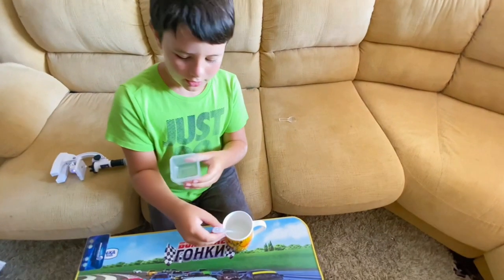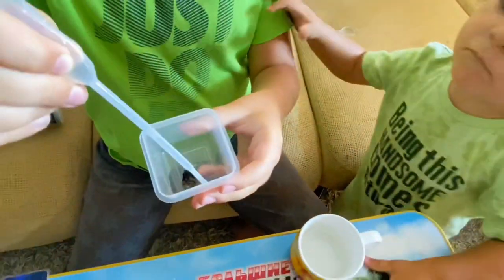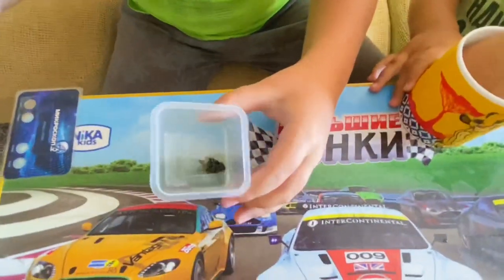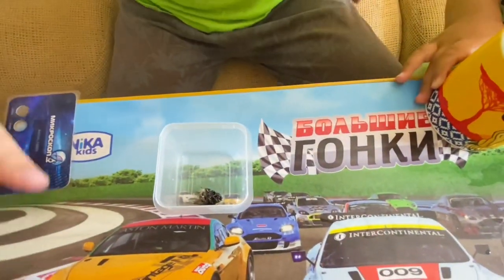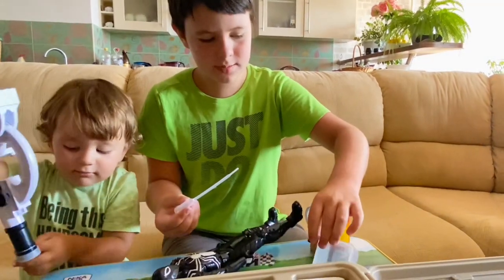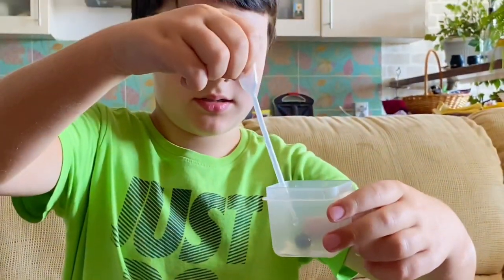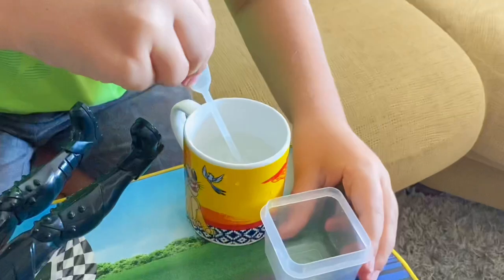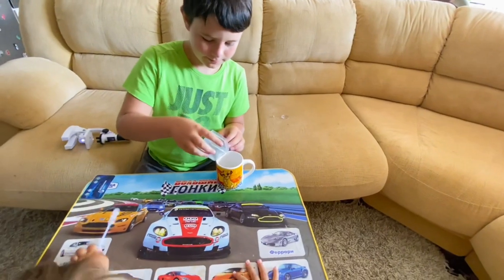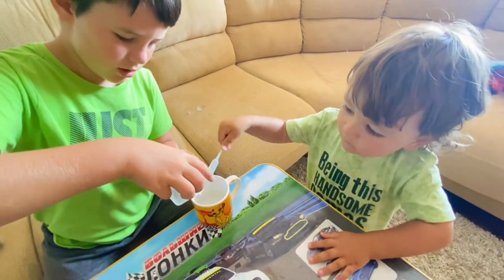Okay guys, now we have the water. Now we're gonna put some water on the bee. Just a little bit more. And now we have some water on the bee — now it's a really wet bee. I think we can just pour out the water. Here's the water inside. Now we're just gonna put the box like that. We can do a little bit more, but I think that's good enough. Done.